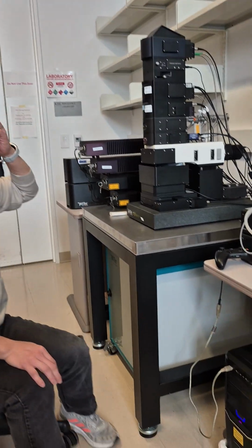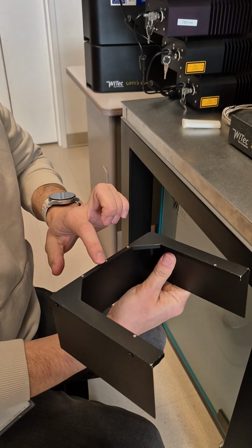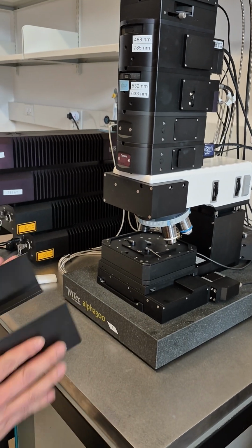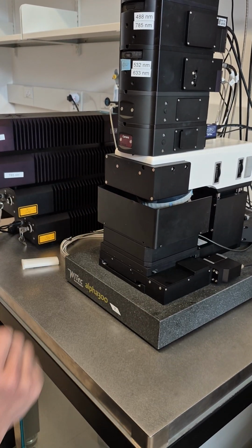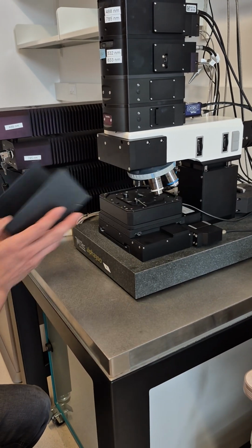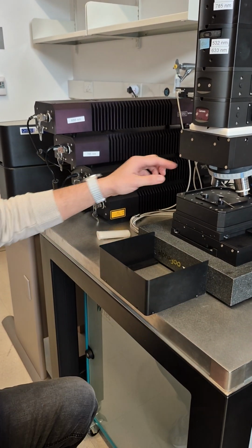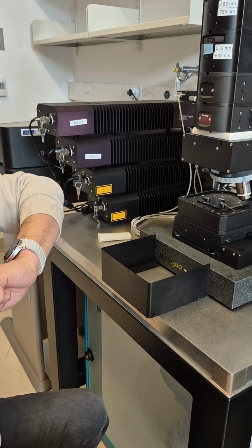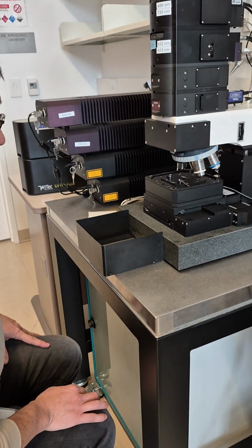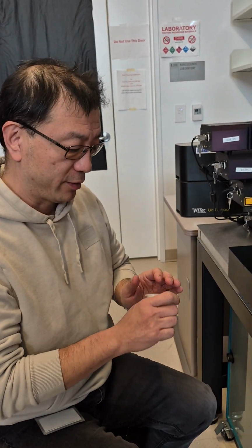The microscope. This is called the laser shield. It has 5 magnetic points that match the 5 points on the stage, so it will stay in position by the magnetic force. Most of the time, users don't use this one. The objectives, we have 5, and I'll show you, it's also stated in the manual. Not all the objectives are usable for every sample.